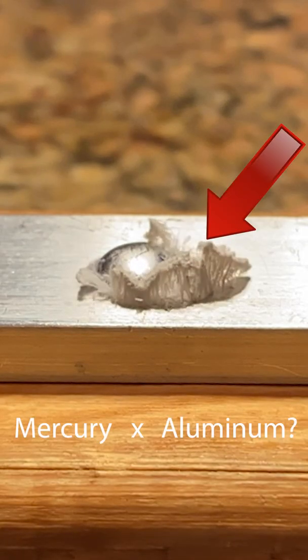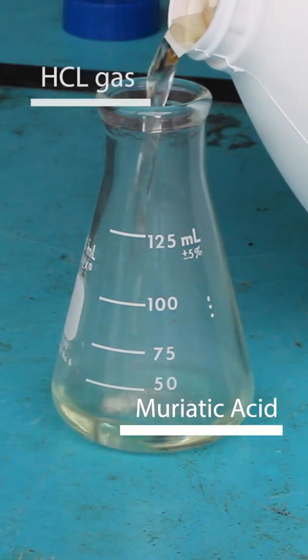Why does mercury cause this reaction with aluminum? In order to start the experiment, I need some dilute hydrochloric acid.